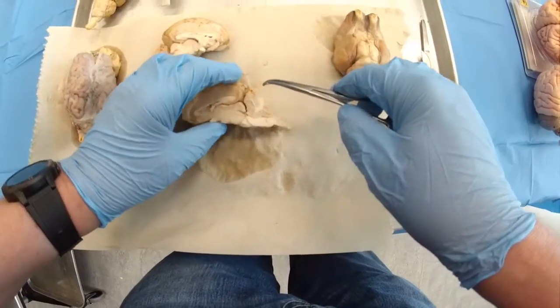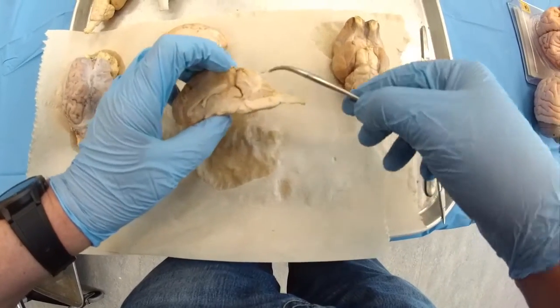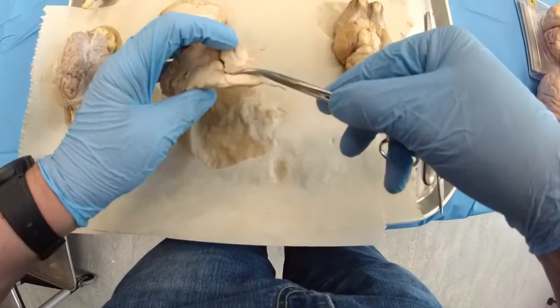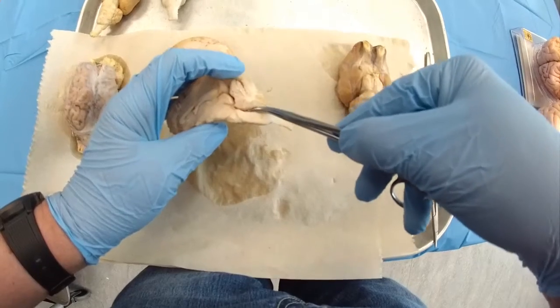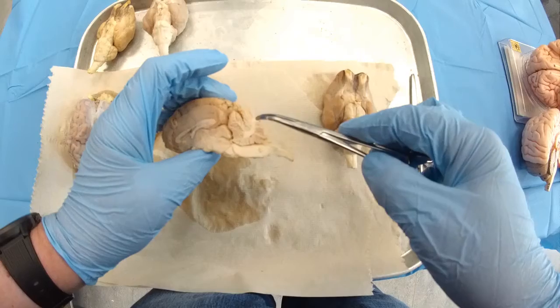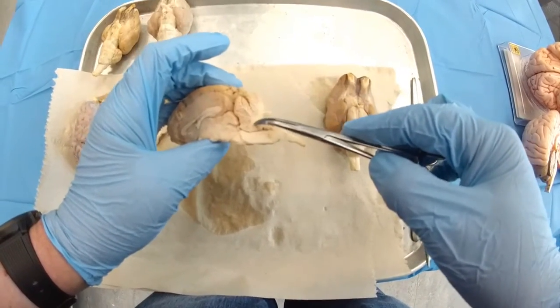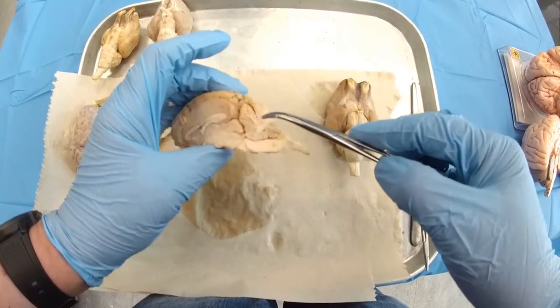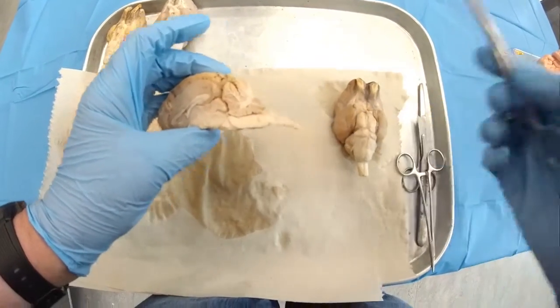Then the famously known cerebellum. And the cerebellum actually covers the fourth ventricle. This is the fourth ventricle. Practically it's the roof of the fourth ventricle. Famously known structure here, arbor vitae. So practically it resembles a bush or tree. Arbor vitae is actually from Latin, meaning tree of life. So mainly it's the separation between white and gray matter. Okay.